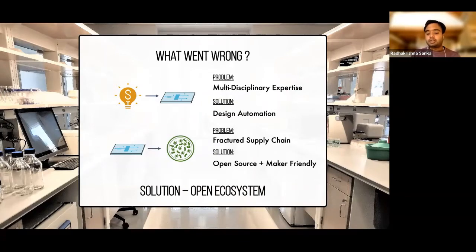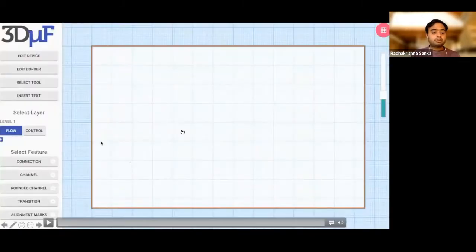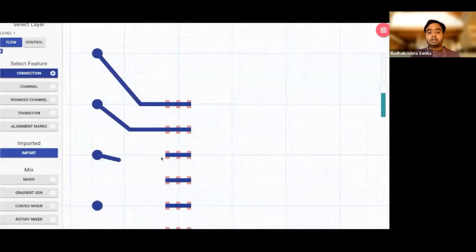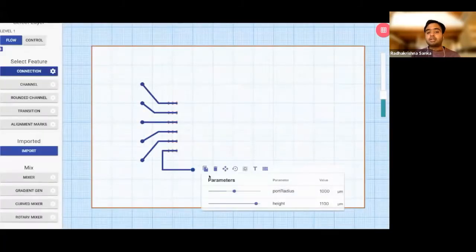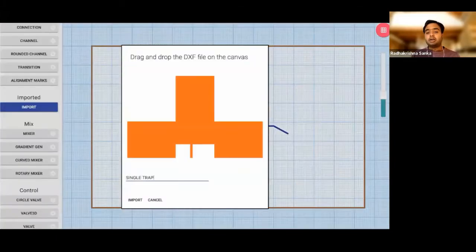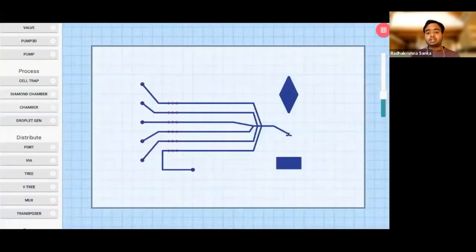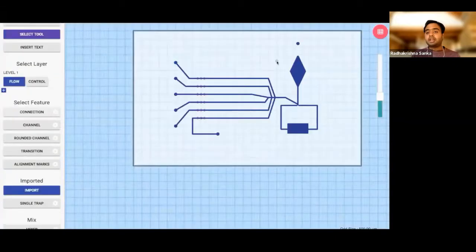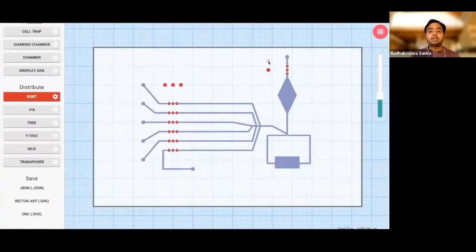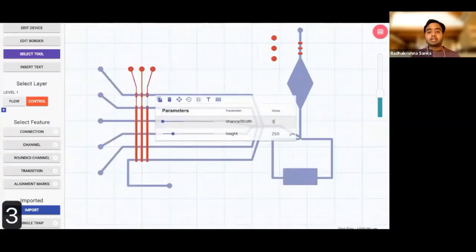And that's where 3DuF and a lot of my research actually comes in. This is a quick screenshot of going from idea to design of an entire microfluidic device. This is sped up, obviously, but it took me a grand total of 20 minutes to make this entire device design. If you were doing this in something like AutoCAD or SolidWorks, it would probably take you 2-3 hours at the very least. I mean, we have some folks in the workshop here who are probably experienced in making these designs, so I'd love to hear more about what your experiences have been in designing devices.